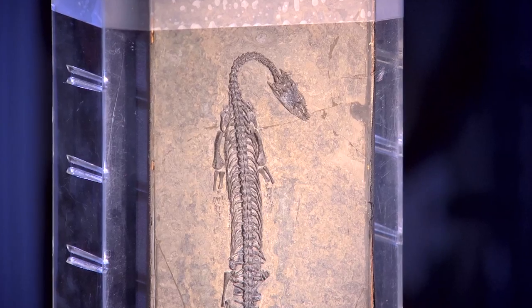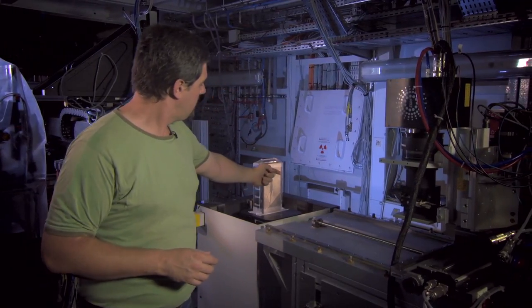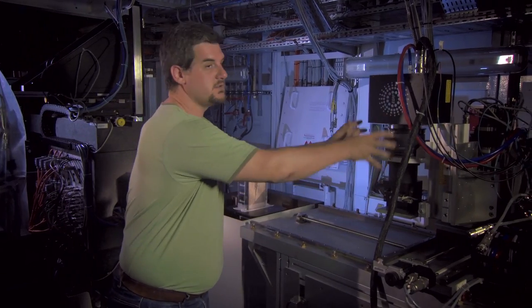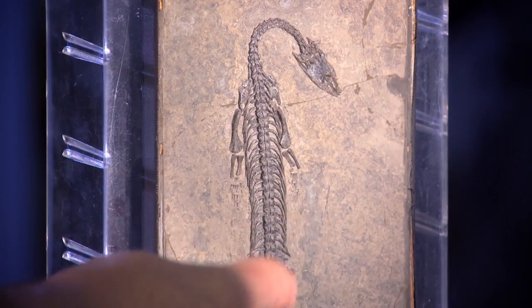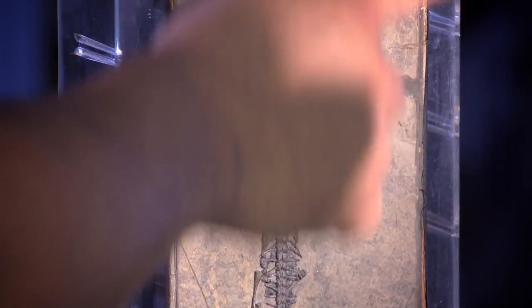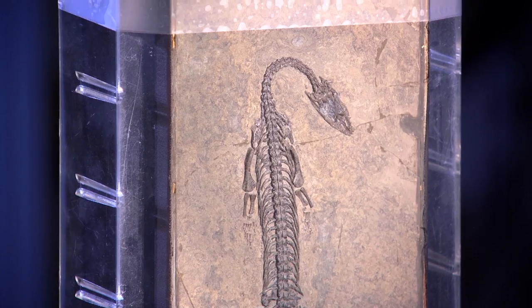The synchrotron beam comes from this side, goes through the sample, and after that goes into the detector where the X-rays are converted into visible light. There is a microscope system and a big CCD camera that is extremely sensitive and quite rapid. On such samples we can do a complete picture of the specimen at low resolution, and then examine any part of it at high resolution.